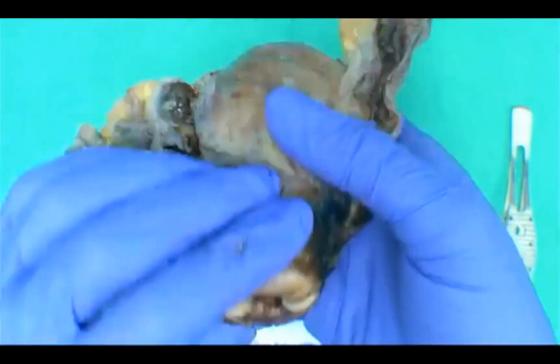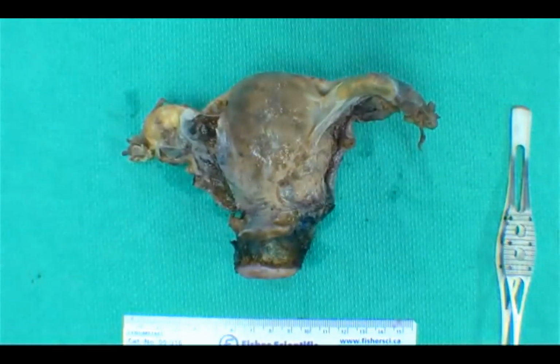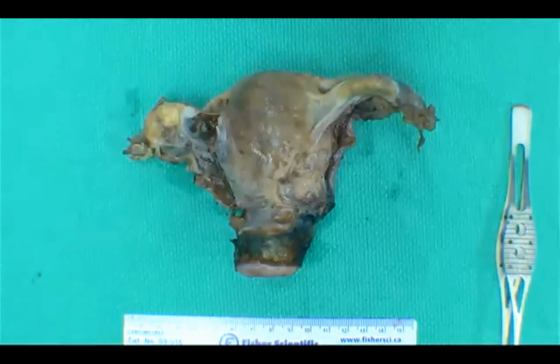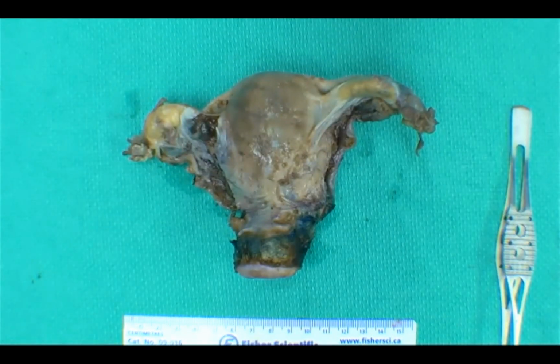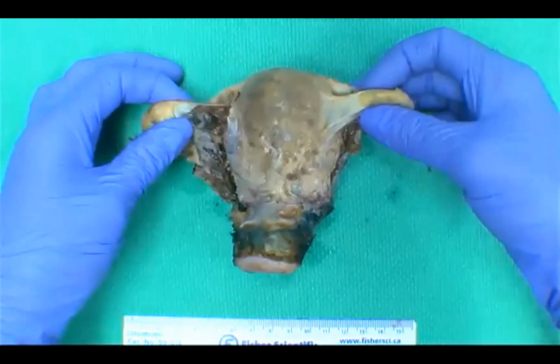However, speaking on cervical cancer, what type of resection would you expect to receive with a cervical cancer specimen? Vaginal cuff, great. Well, it depends on the clinical stage for sure. But usually with cervical cancers, you do expect to receive a radical hysterectomy that tends to have vaginal cuff and parametria. But we're not seeing that here. Sometimes you can get just a trachelectomy. I think we'll just continue on this cervical cancer discussion.